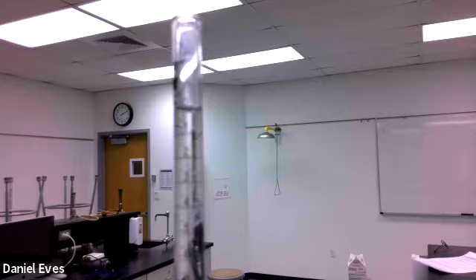you can do the calculation to figure out how many grams of sodium hydroxide you need to put into 300 milliliters to make the solution. Now it says to be about 0.1 molar sodium hydroxide, but the problem with sodium hydroxide is that it's hygroscopic. And because it's hygroscopic, it sucks water out of the air, and so we never really know with any sort of certainty how much sodium hydroxide there is in the solid.